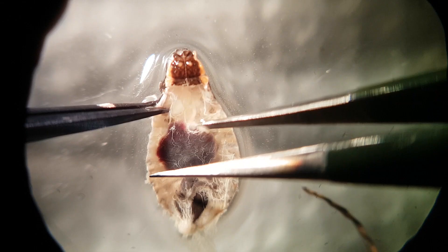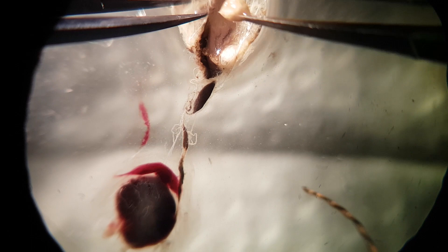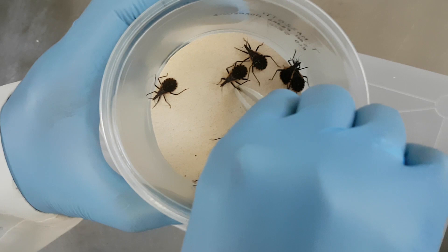Finally, use your tweezers to separate the gut from the rest of the body. Once we have collected the gut, we can perform different experiments using this tissue. Some researchers do these dissections on kissing bugs collected from the wilderness to look for trypanosome parasites.